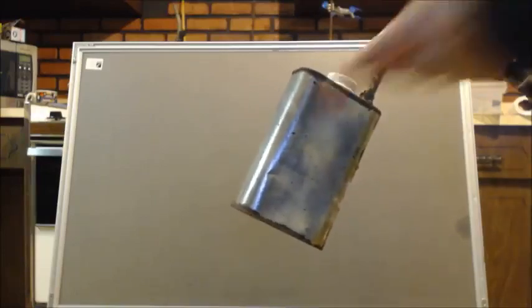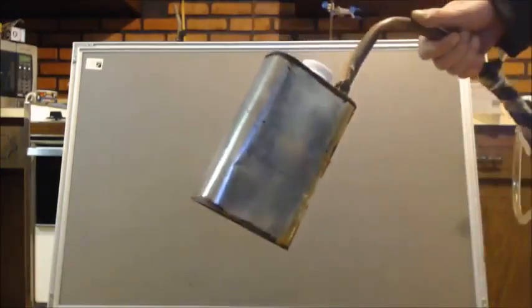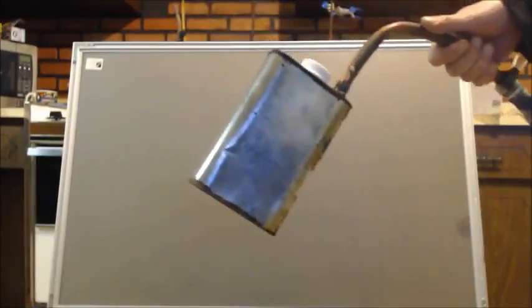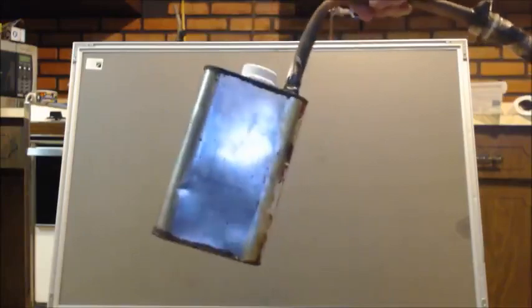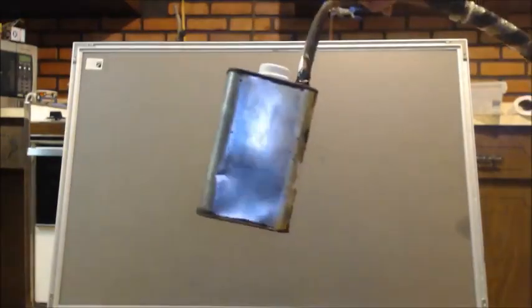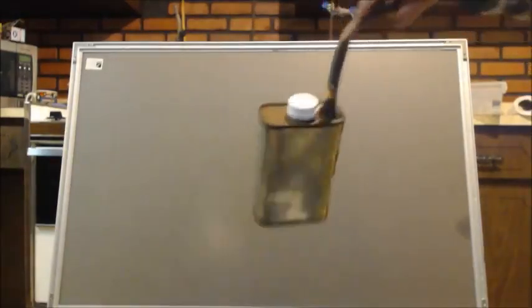You can make a still out of steel, copper or whatever and have it nice. This is garbage, okay? It's nice for novelty, but it's not safe to be making this and using it unless you're going to use it to distill water. So I do not recommend anyone make this.